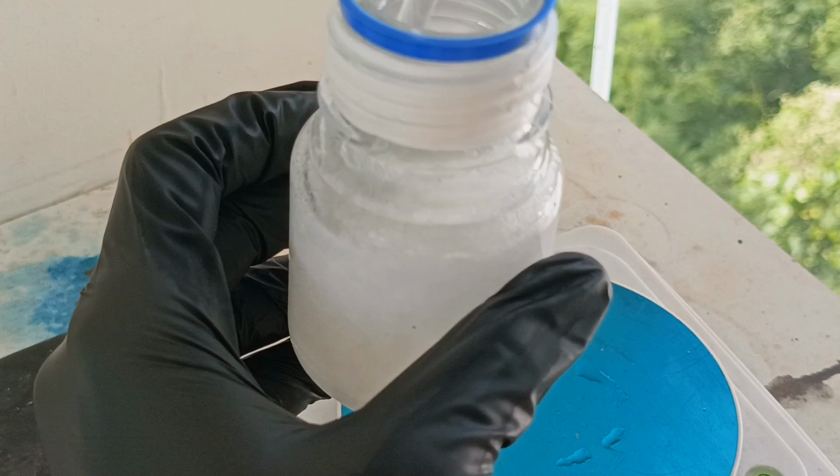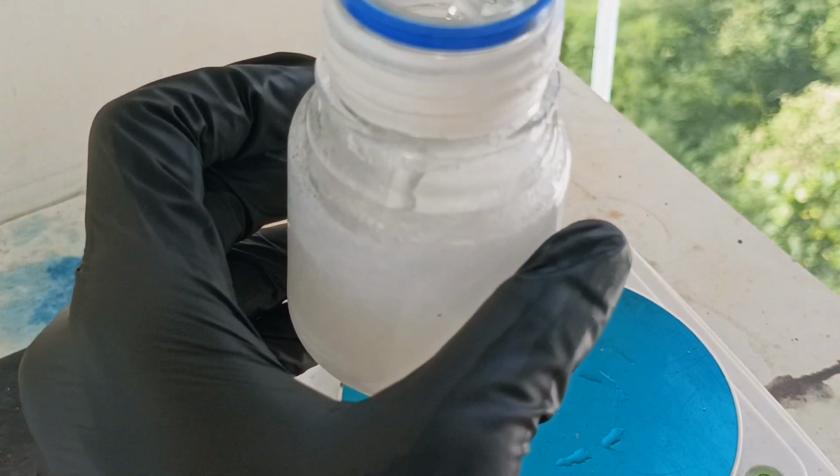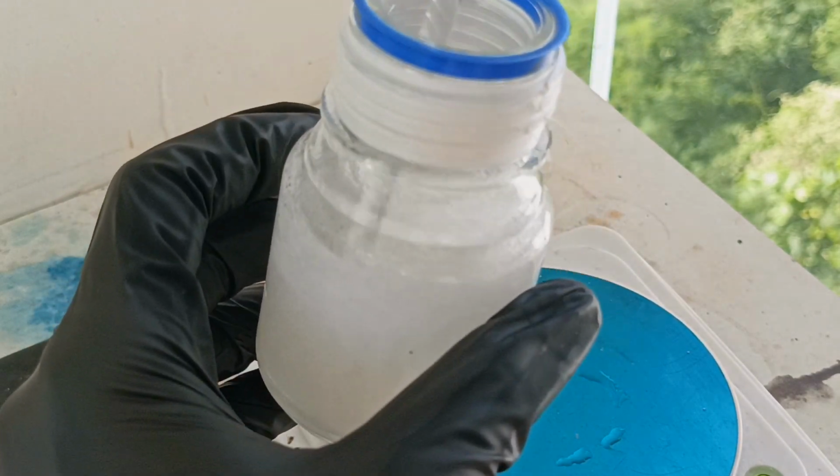Anyways, that's it for this video, and in the next few parts, I'm going to be converting the phenol into 3-nitrophenol. Stay tuned.